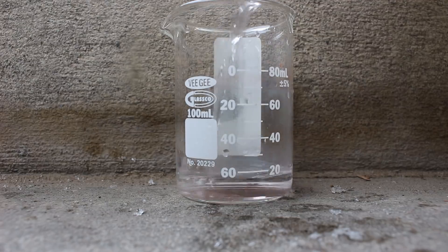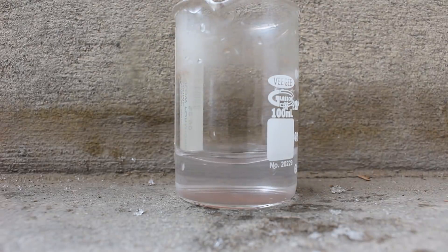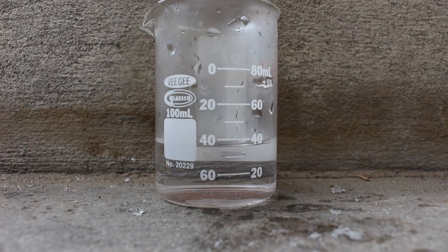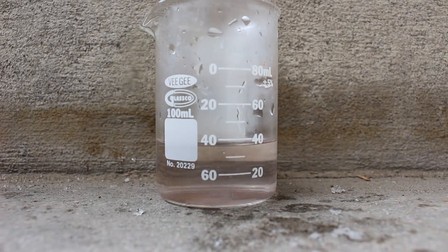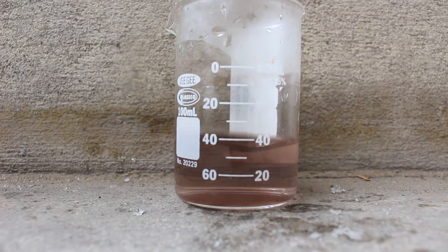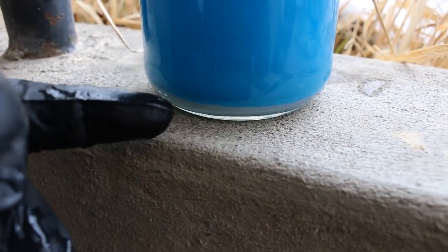Let me demonstrate this. Here's some pure water — I'm going to add some stannous chloride to it. As you can see, there's no color change whatsoever. Now I have a little bit of gold chloride here, which I'll put in using my stir stick. Now you can see the color's changing — it kind of gets to a purple color. That's because it precipitates out colloidal gold, because tin is another thing that will make gold fall out of solution.